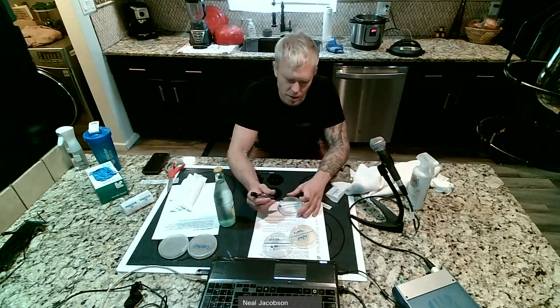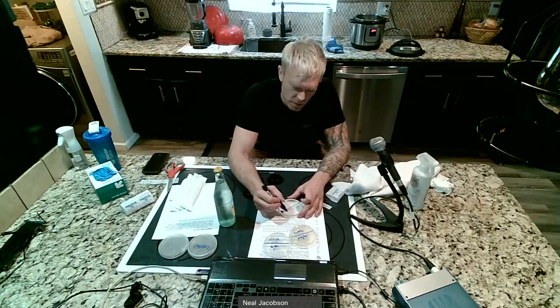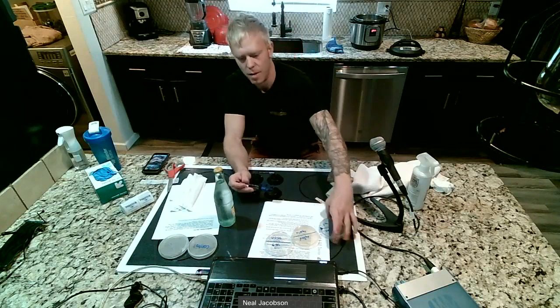And then finally, let's do hair, like my head, and feet, like the bottom of the foot. So I'm going to do the bottom of the foot, and my hair.